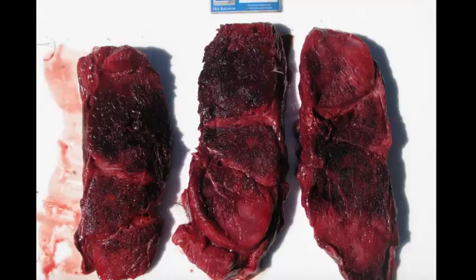For slide 1, this is tissue from an ox. Can you give me a morphologic diagnosis, the cause, and appropriate etiologic diagnosis? Okay, time's up. We're looking at 3 sections of skeletal muscle, and the normal part is the reddish part. The abnormal part is the dark red to black part. The condition is known as blackleg.